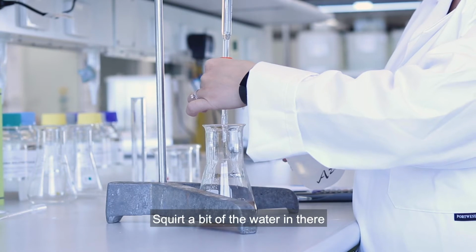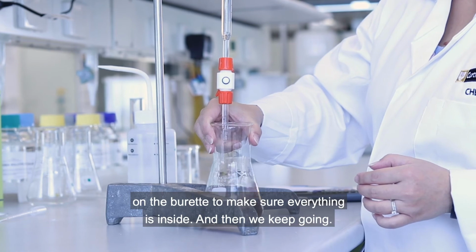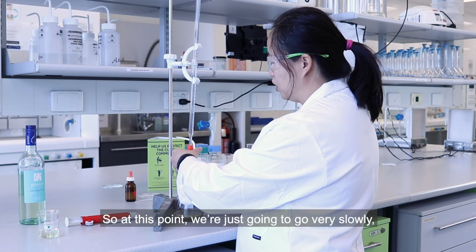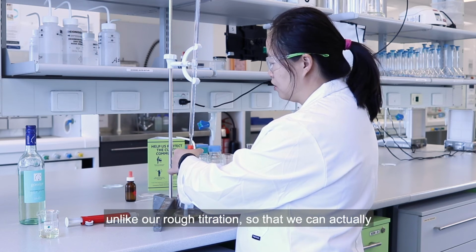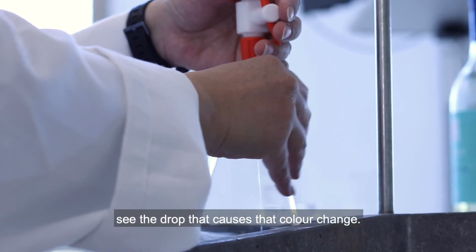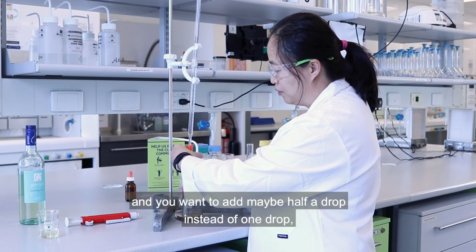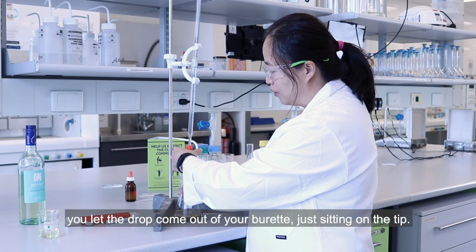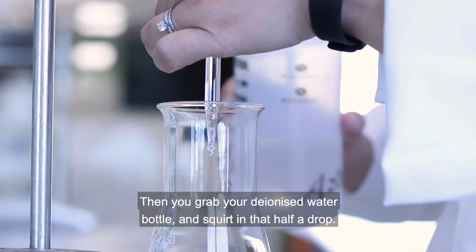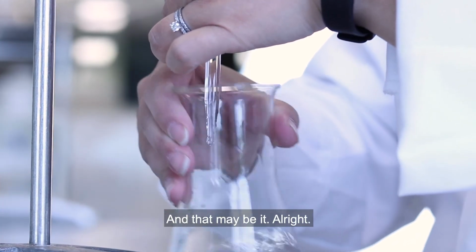Squirt a bit of the water in there, and on the burette, to make sure everything is inside, and then we keep going. So at this point, we're going to just go very slowly, unlike our rough titration, so that we can actually see the drop that causes that colour change. So when you're almost at the end point and you want to add maybe half a drop instead of 1 drop, you let the drop come out of your burette, just sitting on the tip. Then you grab your deionized water bottle and squirt in that half a drop. And that may be it.